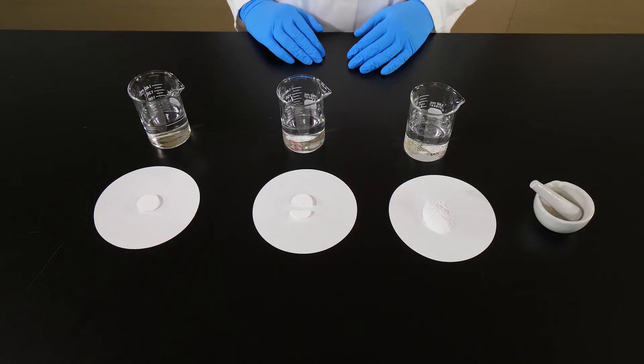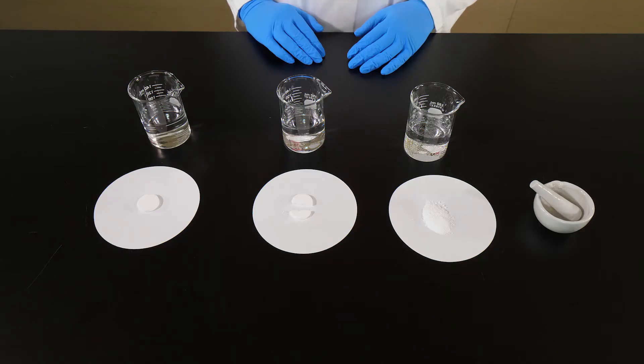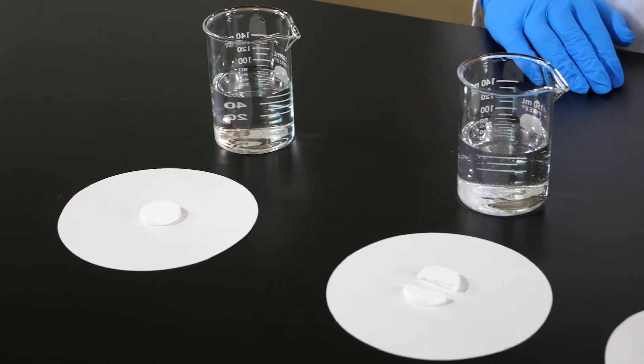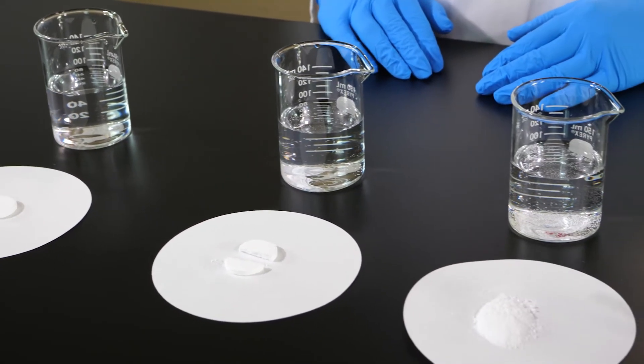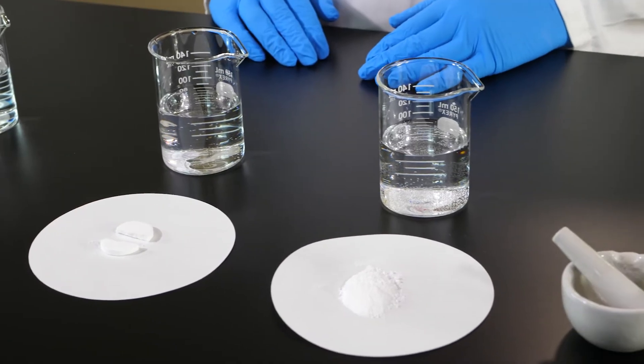In this experiment, we will perform 3 tests to demonstrate how increasing the surface area decreases the digestion time.